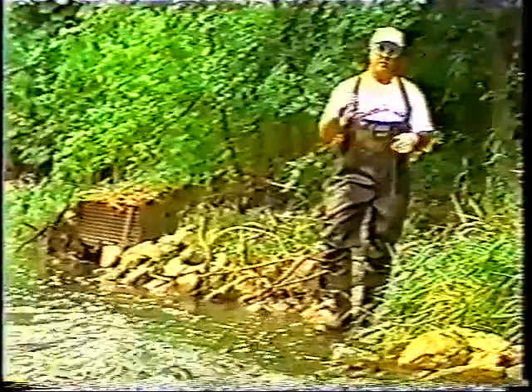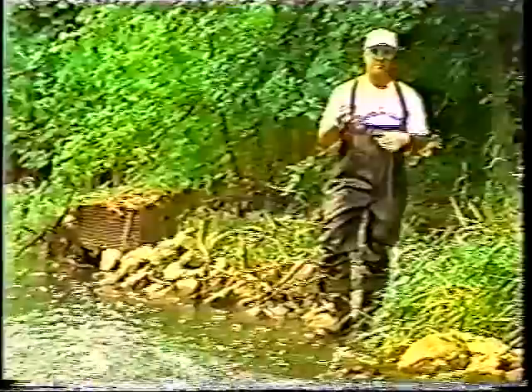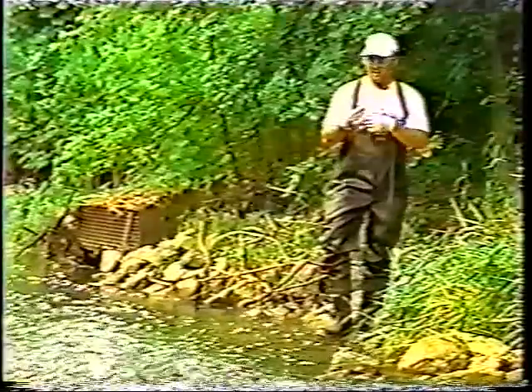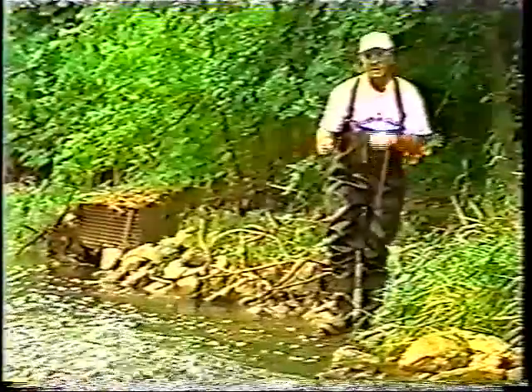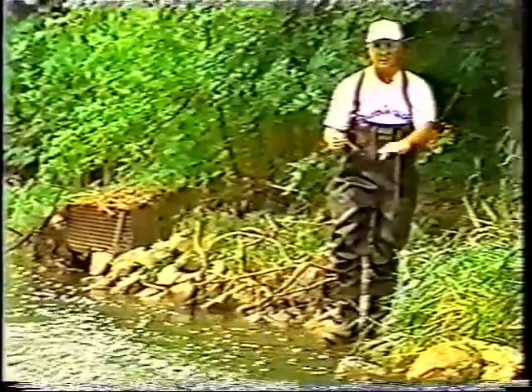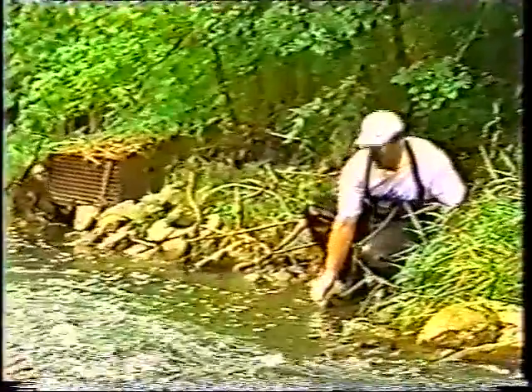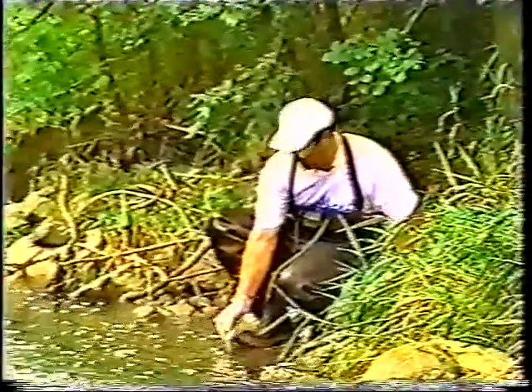So what you'll do is you'll get a thermometer and you're going to look for your temperature in degrees Celsius. This particular thermometer has both Celsius as well as Fahrenheit temperature gradients. So what we'll do is you'll find a spot where you can take the temperature several inches below the surface. You don't just want the surface temperature of the water. You want to get it several inches below the surface, and we'll let it sit there and stabilize for a minimum of 30 seconds to a minute, somewhere in that range.